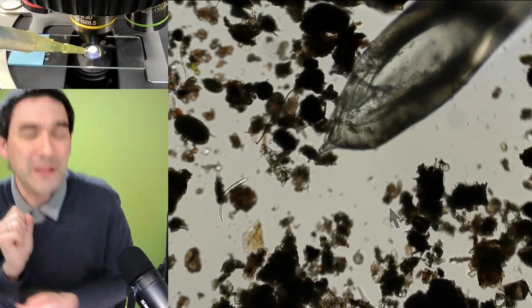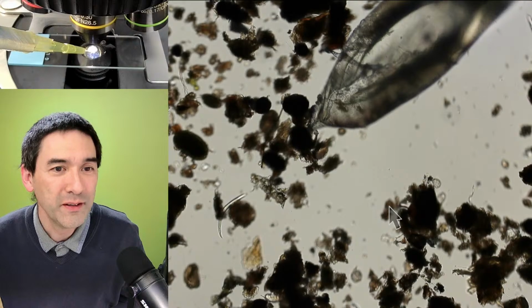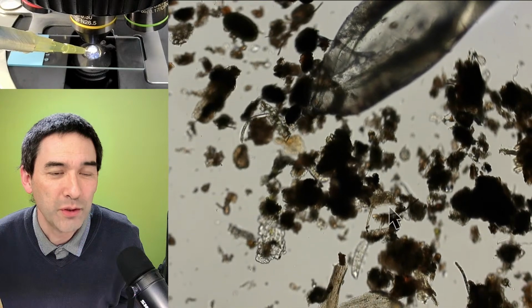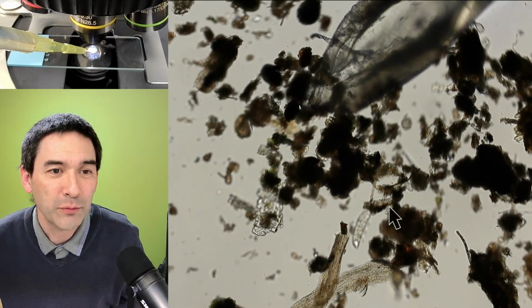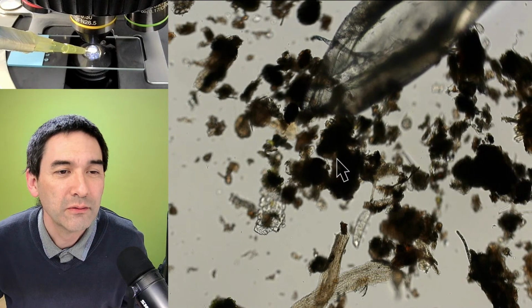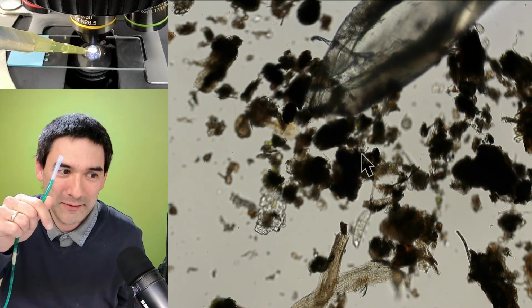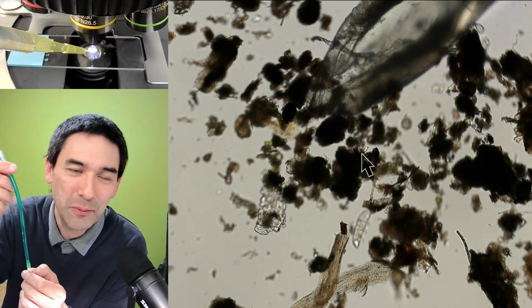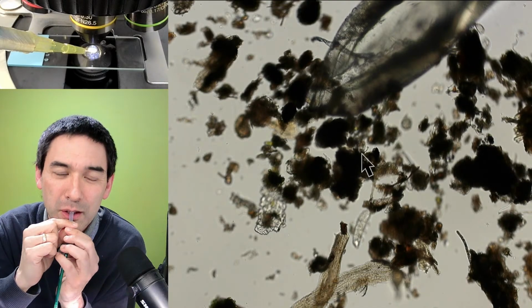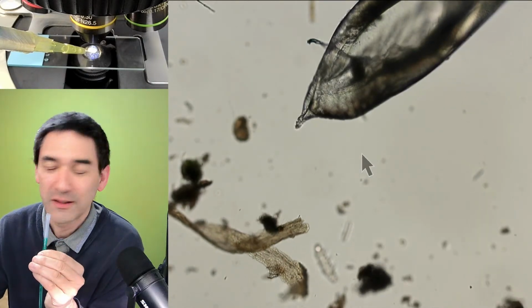You see now the tip of the pipette, and look, I can now move the stage. And I'm able to do something crazy, and I wonder if it works. I move right next to the water bear, which is hiding somewhere in here, I guess. Here it is, and I'm trying. Look what I have here. It's an air tube from an aquarium, and now I'm going to try to suck it in. Okay, I sucked it in now.